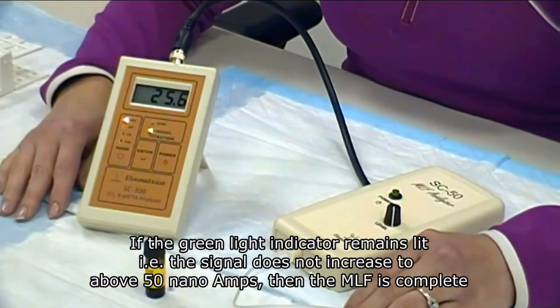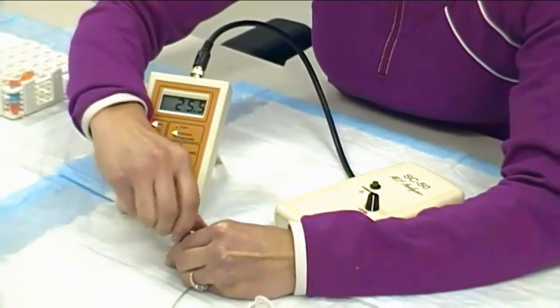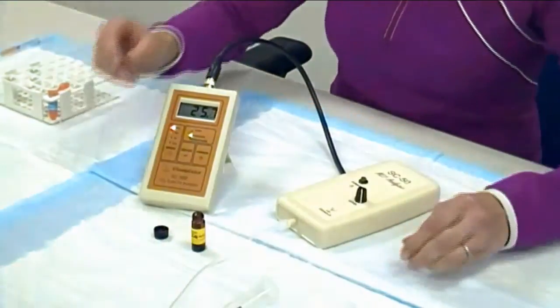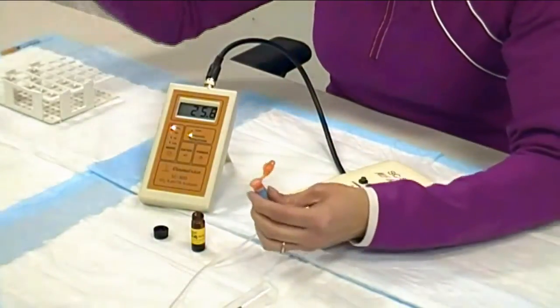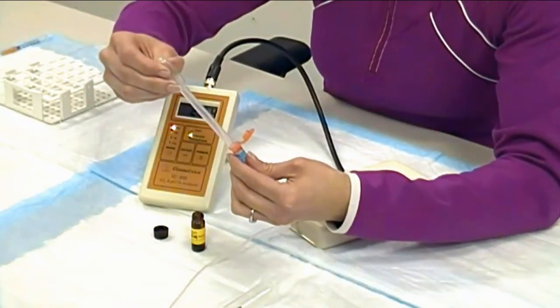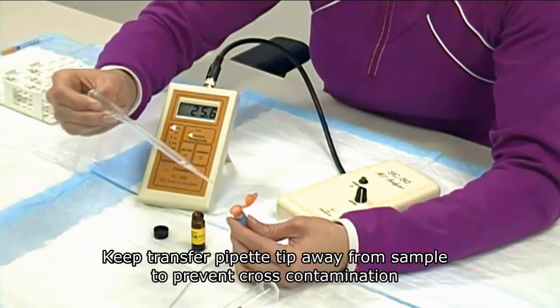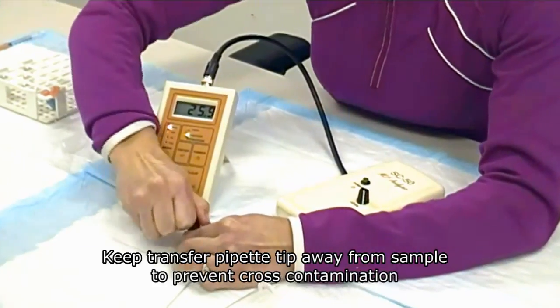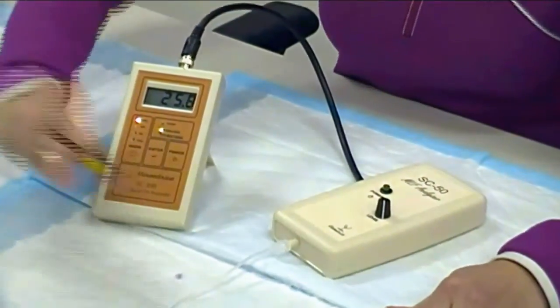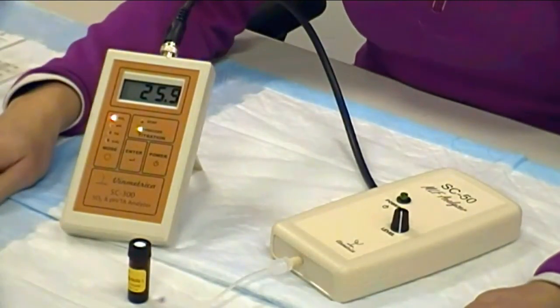To follow the confirmation procedure, open your vial. Take your one molar malic acid and carefully add one drop to your vial. Close the cap, shake, and incubate for another 30 minutes, shaking once every 10 minutes.